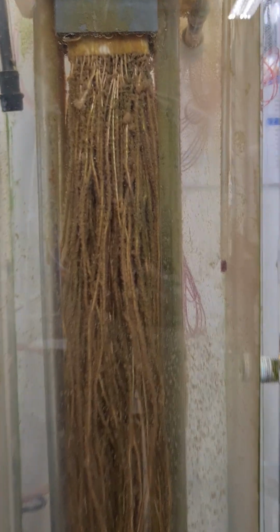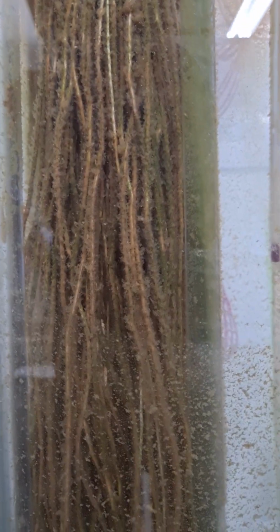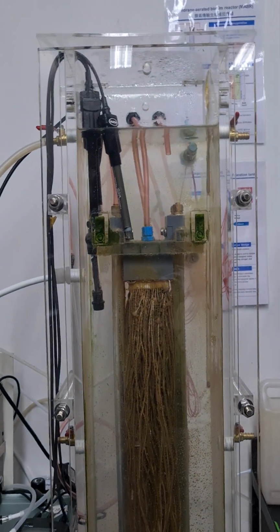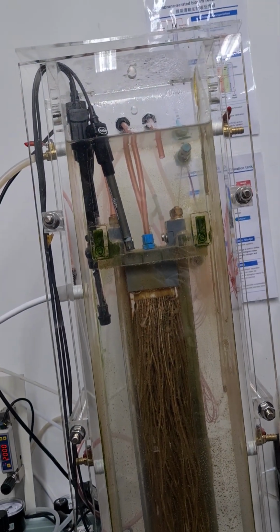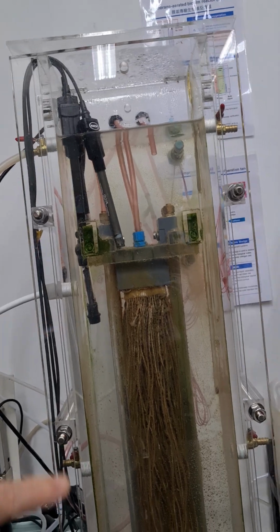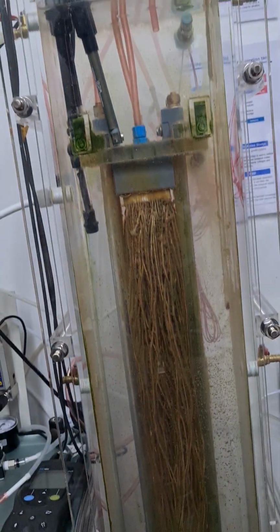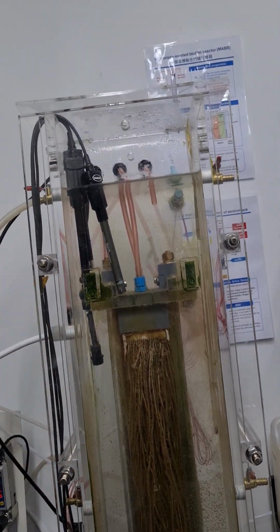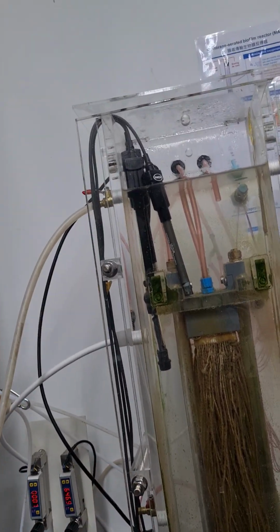That's good. Very interesting. If you completely pack the membrane inside, what will happen? Because in our lab we have a completely packed MABR membrane, with membrane everywhere. So what happens with only a middle-positioned membrane versus a completely packed membrane?